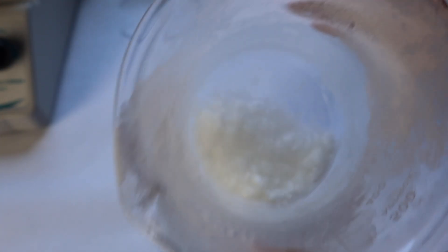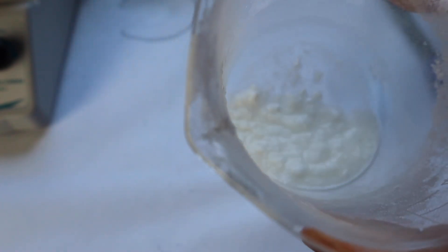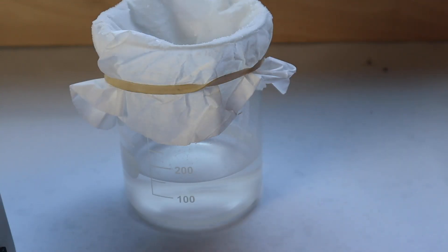What we're left with is a pretty gross sludge of wax, starch, cellulose, and a few other things. I'm just going to let this sit out to evaporate for about 24 hours, maybe 48. We'll come back and see what happened.